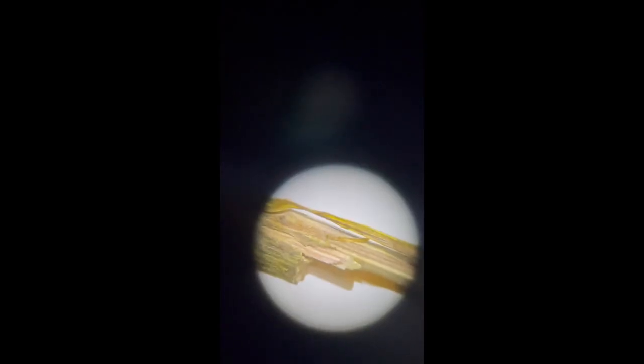So to start off the live dissection, you can see here the woody part of the stem is yellow in coloration, indicating the presence of berberine. Then we have 1, 2, 3 sepals. 1, 2, 3, 4, 5, 6 outer petals. 1, 2, 3, 4, 5, 6 inner petals.